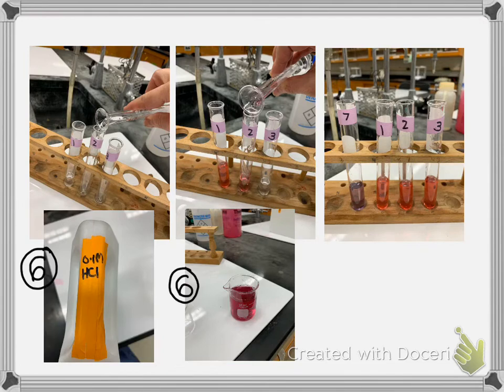There's a little beaker of the indicator. 3 milliliters of the hydrochloric acid and 2 milliliters of the indicator, and make your sample. And so we're only going to look at number 1. Like I said, I had done 3. But here, this right here is the acid and the indicator together after doing step 6.